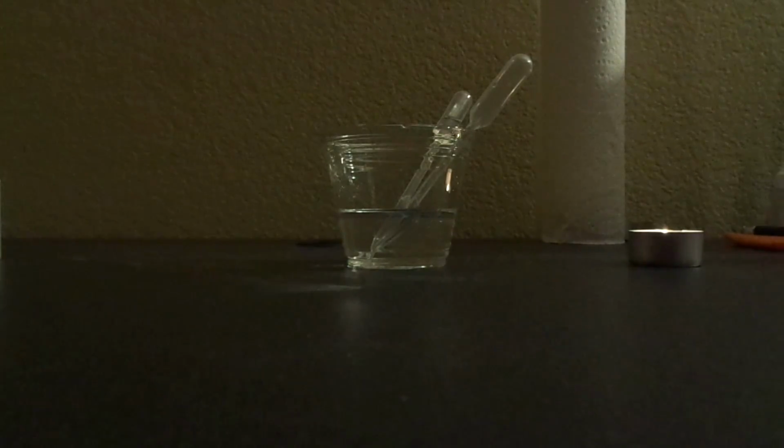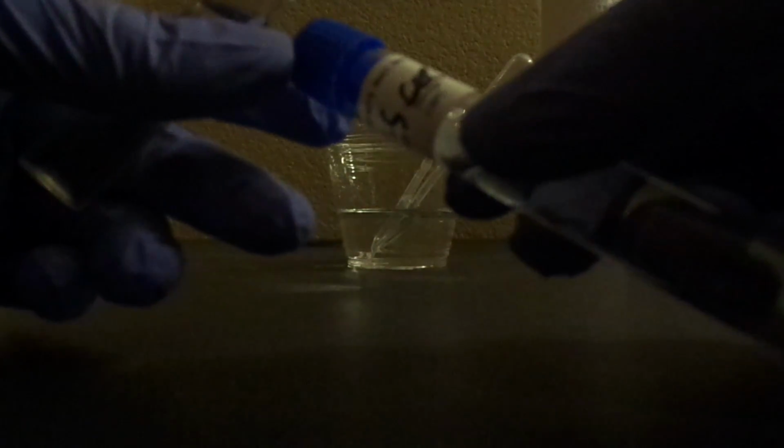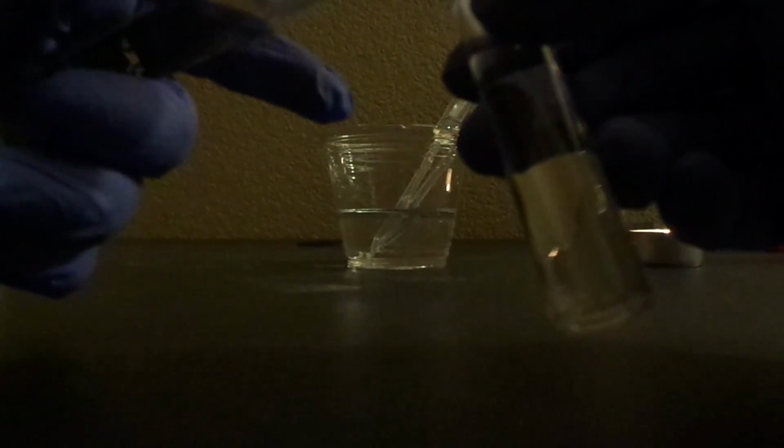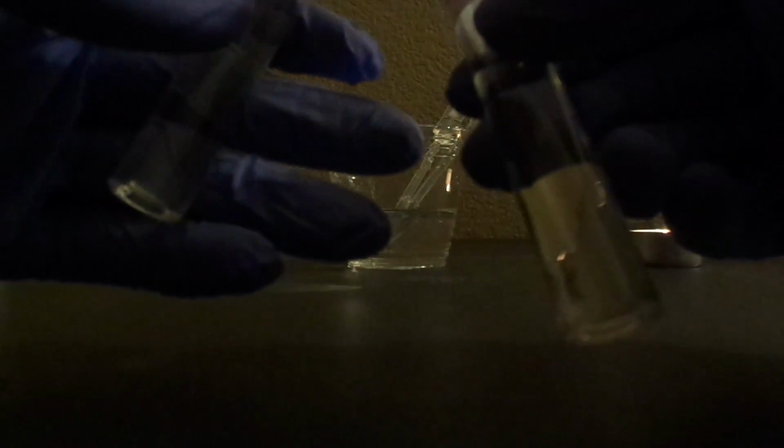Okay, so pretty much the same thing's gonna happen with the sodium chloride tubes. As you see, I've labeled them here. I have the sodium chloride for each species and each concentration of solute. So let me go ahead and do one of these really quick. I mean, it's not much. I'm just gonna put 2 drops of the microbes in each tube.